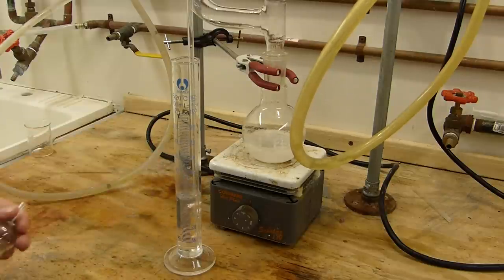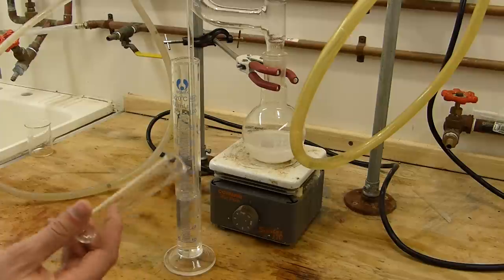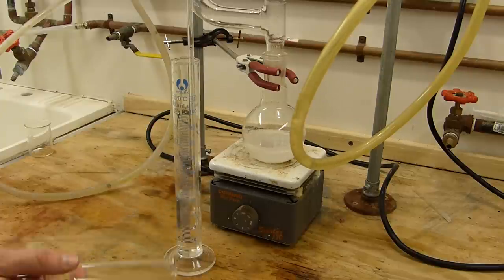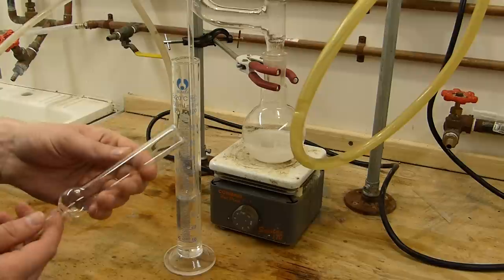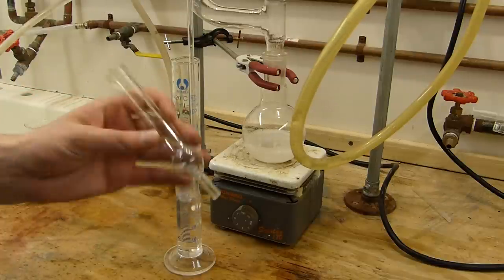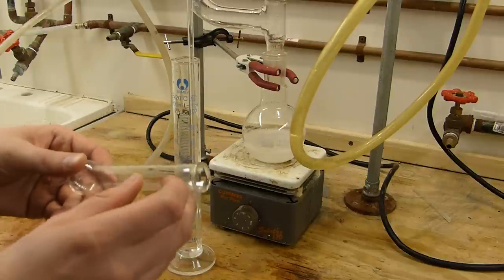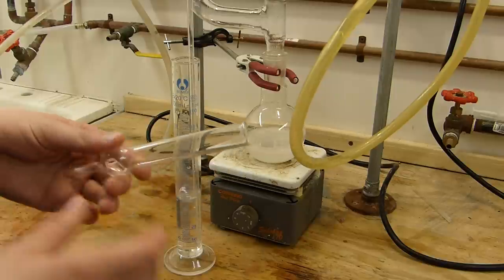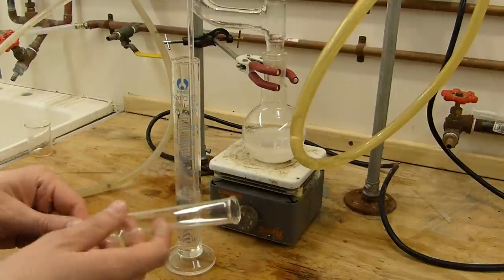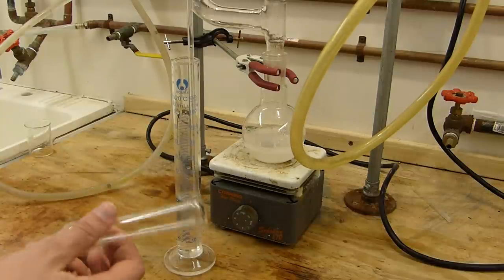Typically the agent used is sodium hydroxide or potassium hydroxide, but the problem with them is that they're very hygroscopic, and if they do get a little bit wet, they tend to liquefy, and the liquefied desiccant will then run out of your drying tube and potentially into your reaction. So you have to be very careful with that. Adding a little bit of sodium carbonate, or a plug of sodium carbonate between your reaction and the sodium hydroxide tends to help mitigate that, and also helps to further dry it. Just make sure that your sodium carbonate is very, very dry when you do that.